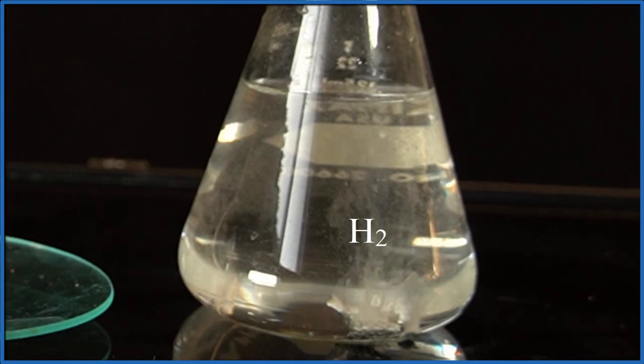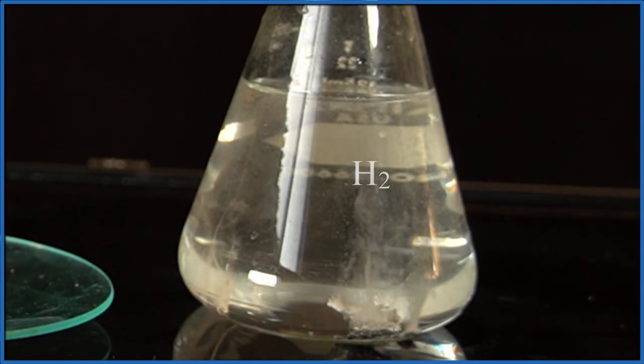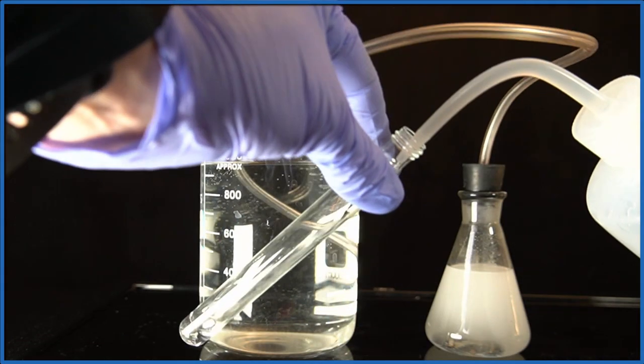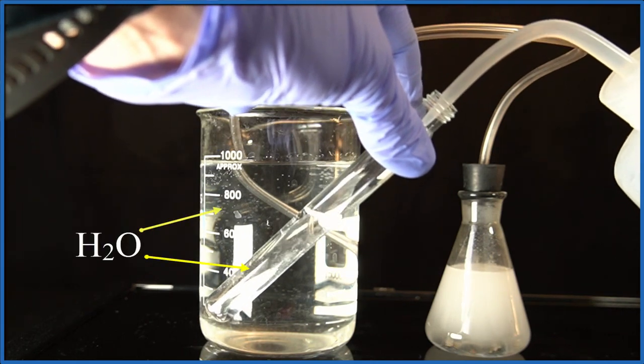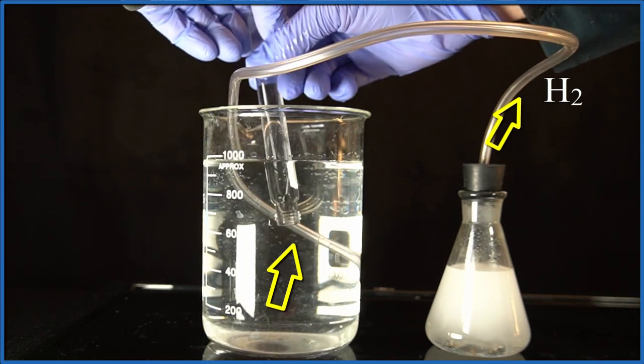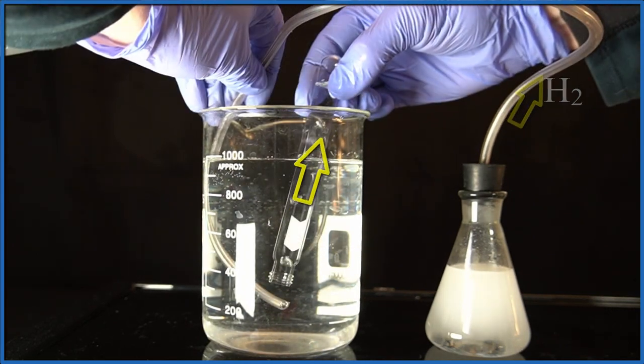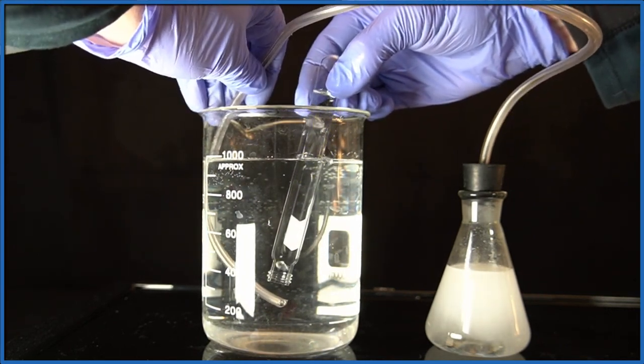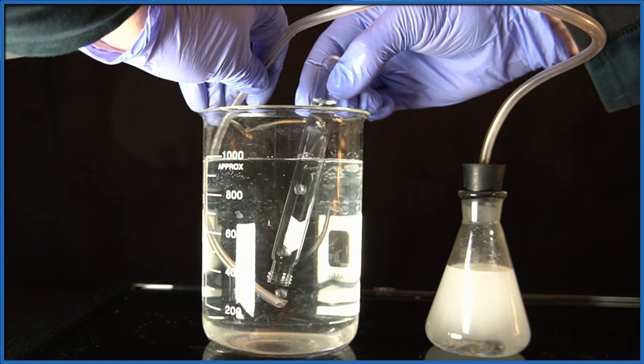We can actually capture that hydrogen gas, it's called collecting a gas over water, where we fill a test tube with water and we put it in this beaker here, and all of the hydrogen gas goes through the tube, and you can see the bubbles going up into the test tube, they're displacing the water. So that's gonna be pure H2 gas.